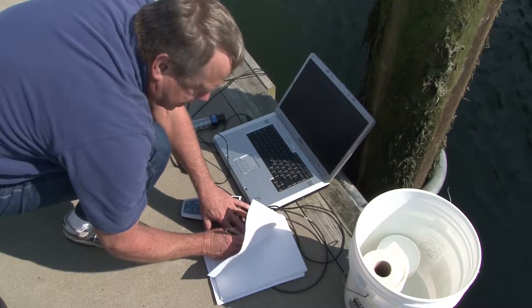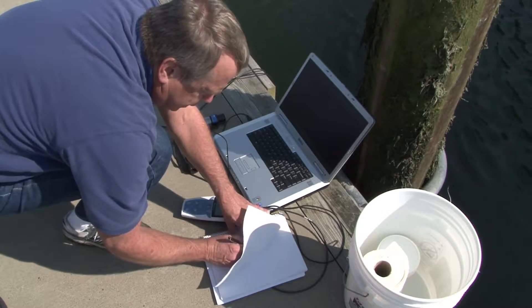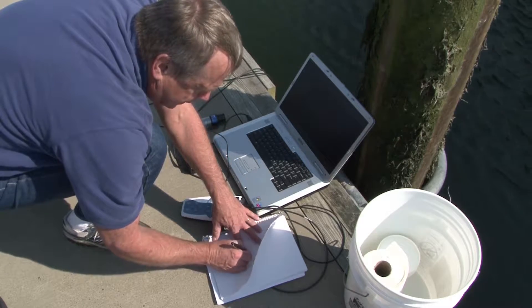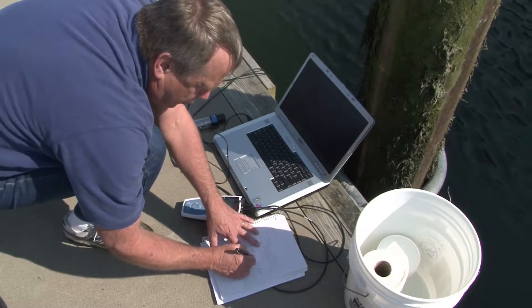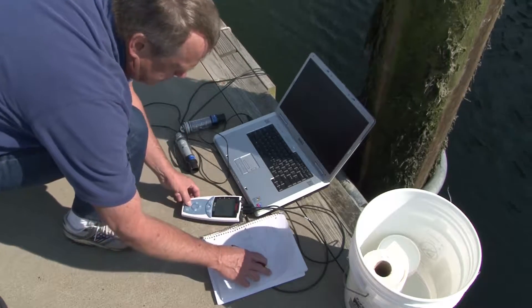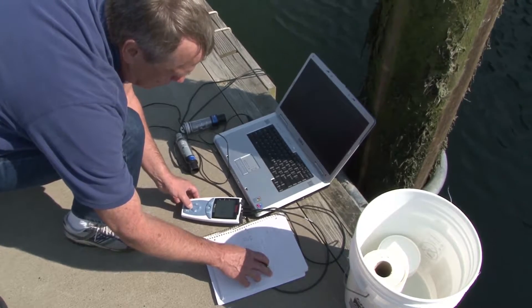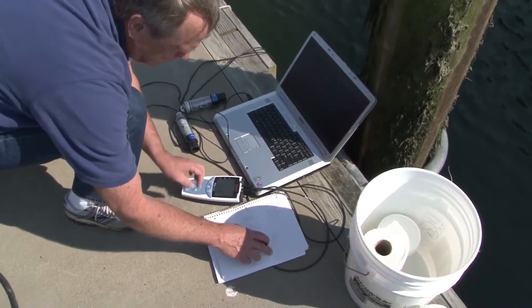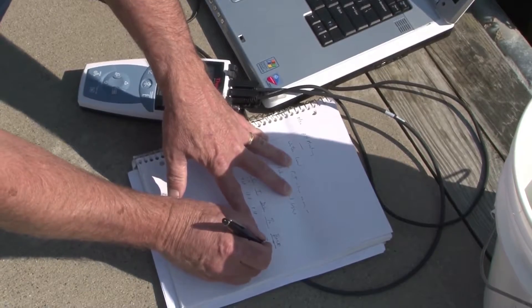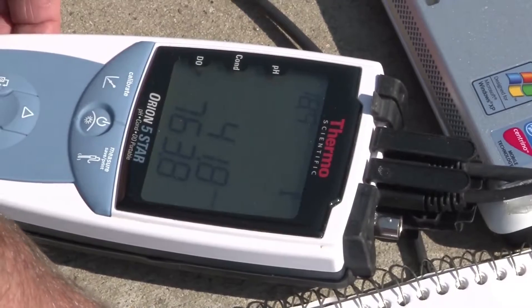I have to record the date and time, as well as the conductivity: 41.8 millisiemens per centimeter. Temperature is 18.9 degrees centigrade. DO is 8.18. This meter also has the ability to measure barometric pressure: 763.8, which will be useful for the percent saturation calculations that we'll see later.